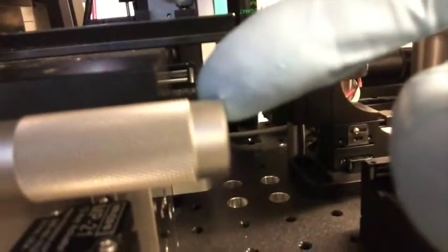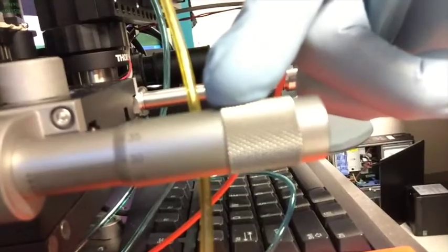Right parallel with the camera, so here's the camera. Right below the camera is a knob that adjusts the camera in and out so we can focus. And likewise, here's the cutter, and right down from the cutter is a similar looking knob. That one moves the cutter in and out for when we get ready to cut.